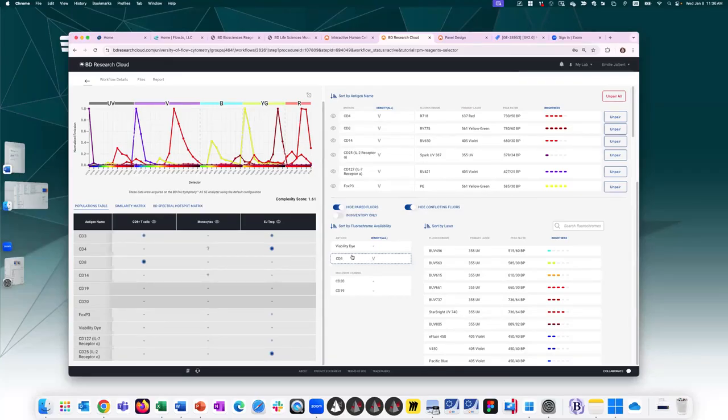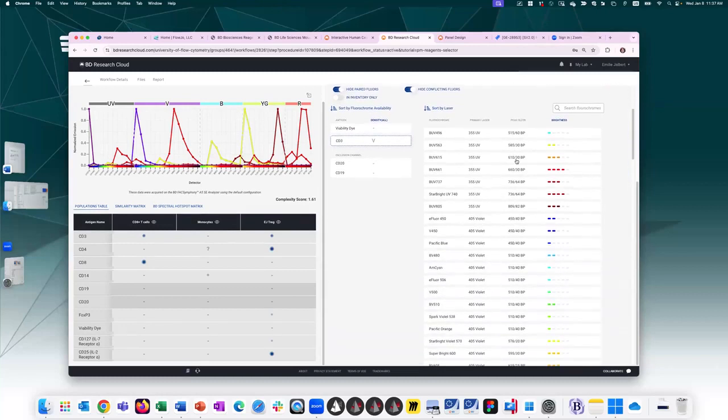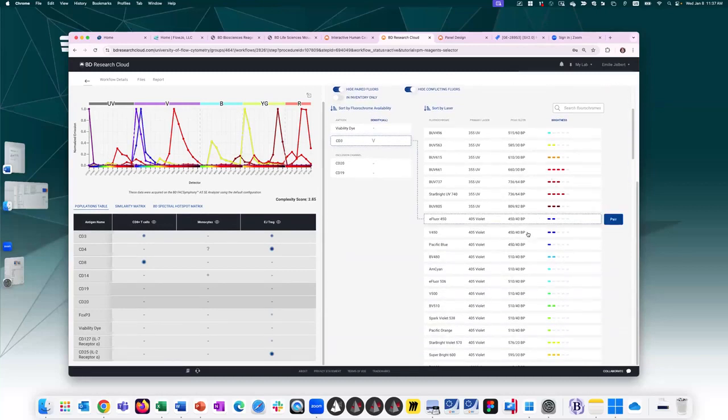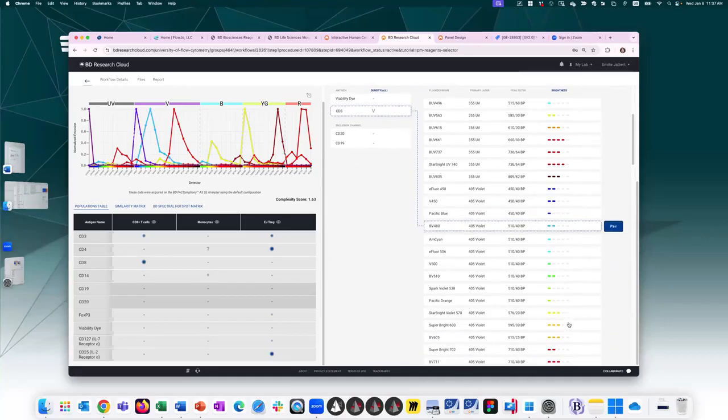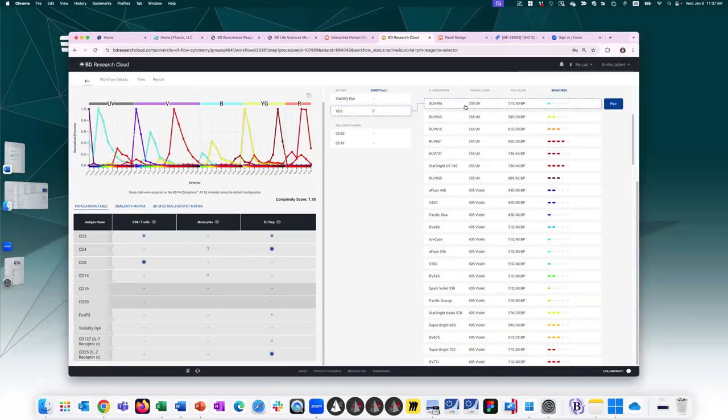Okay, last marker here, CD3 is medium antigen density. Let's go ahead and give it a medium fluorochrome that's out of the way. Just for kicks, let's maybe try something a little bit brighter. So CD3 will be expressed on all the T cells, so I want to make sure it doesn't interfere with any CD4 or CD8. So let's go ahead and put it there for now.